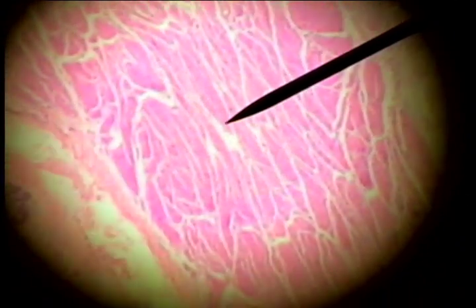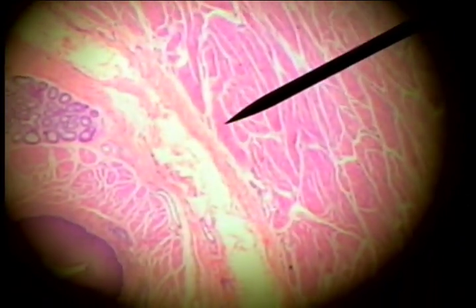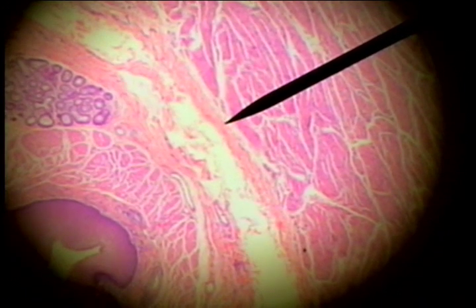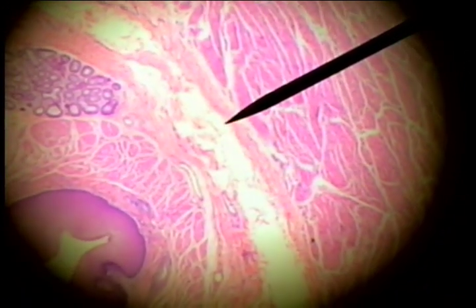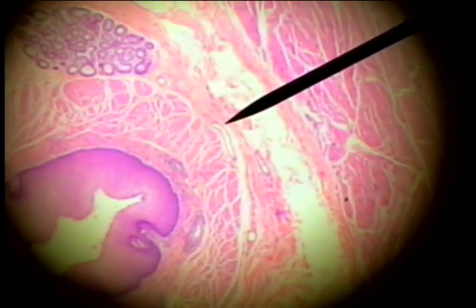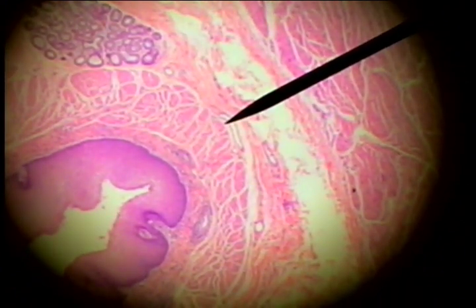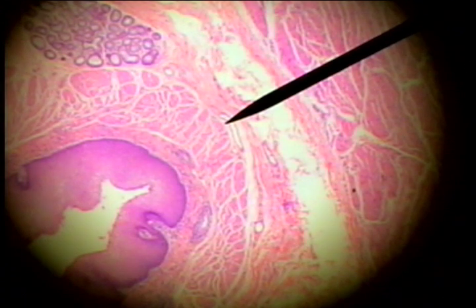As we move on, we find another layer here. This is submucosa, and the submucosa is a loose connective tissue that extends from here to here, and has blood vessels — arteries and veins.